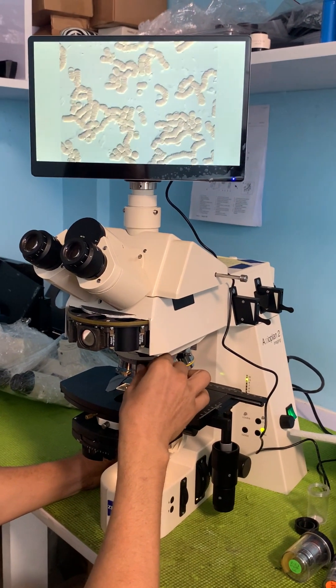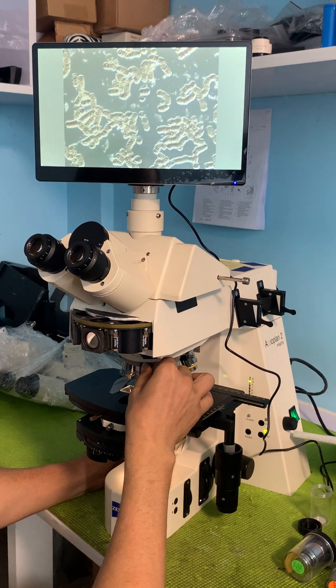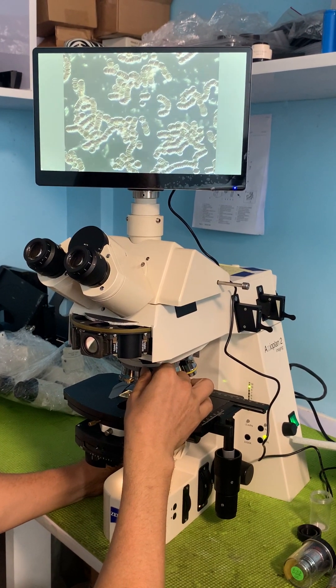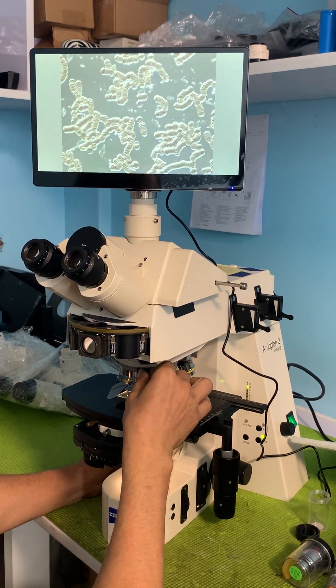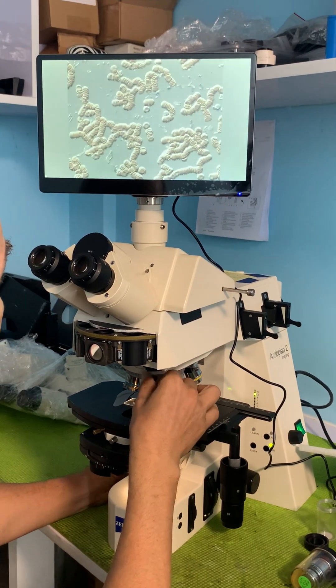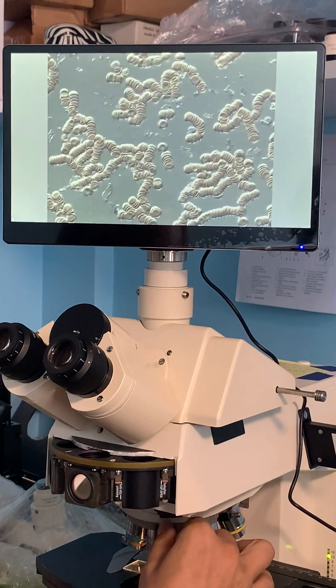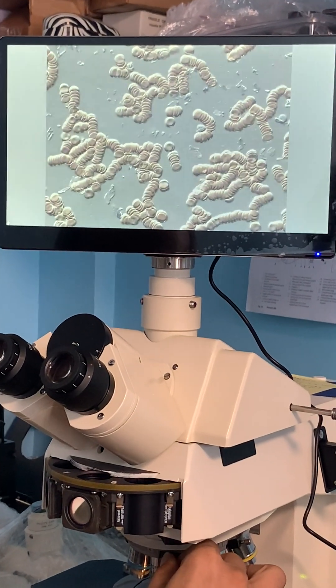So this is DIC — DIC with those same red blood cells.